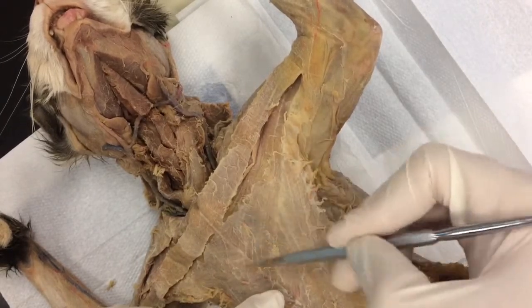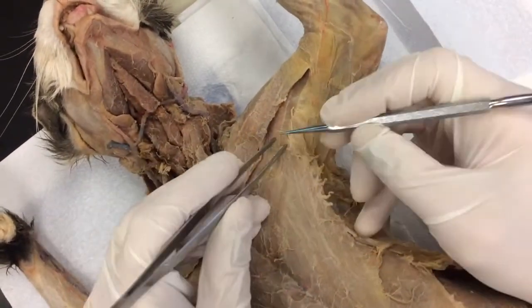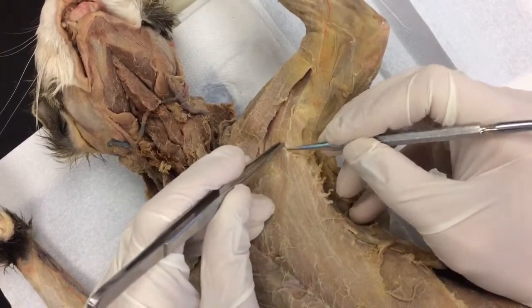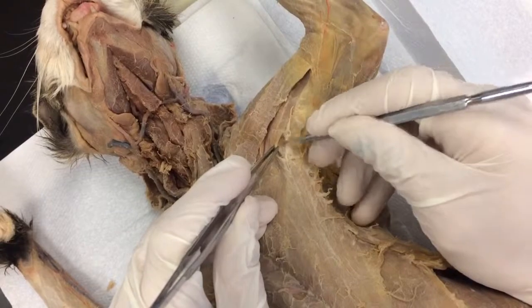Now it gets really tight over here, so we're going to start right up from the armpit like we did last time. Once you have the correct line, take the nose of the forceps right on the line and lift up. You can see it should be really easy to create a pocket. This muscle is ten times easier than the one we just did.